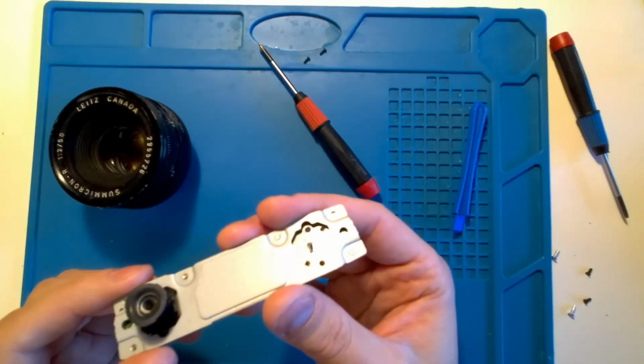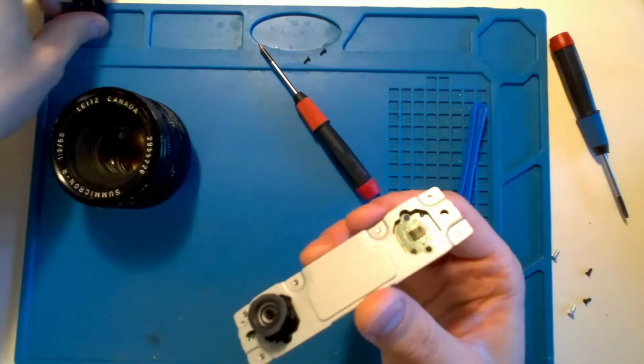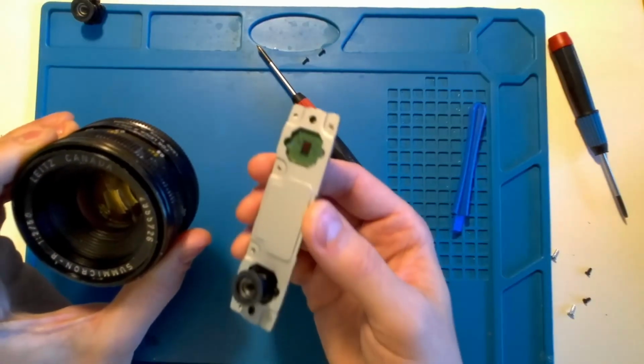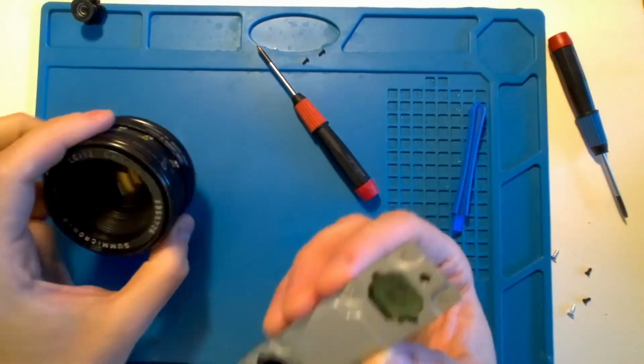And you can see the image sensor in there. It's a small one, but still it's an image sensor. It should work. So what I'll try now is I'll hook this up to the computer and we'll see if we can get some image out of it.